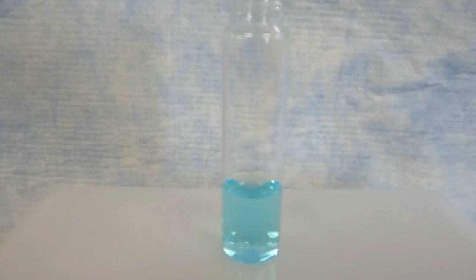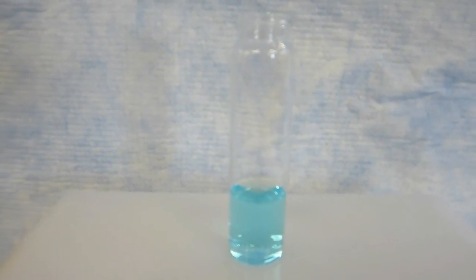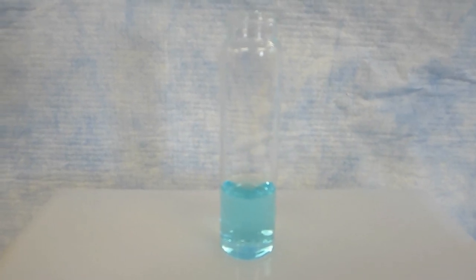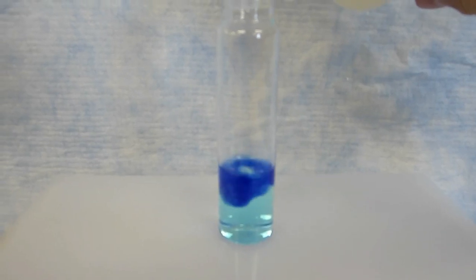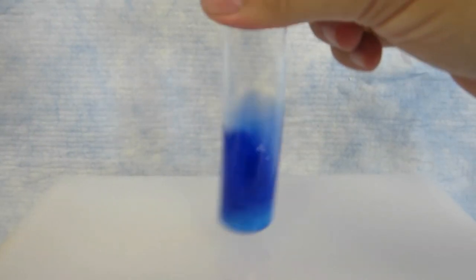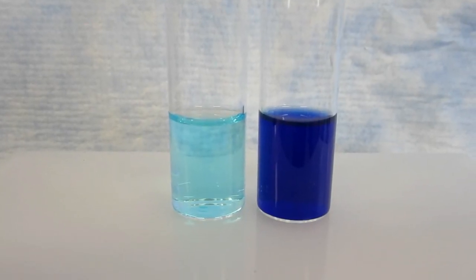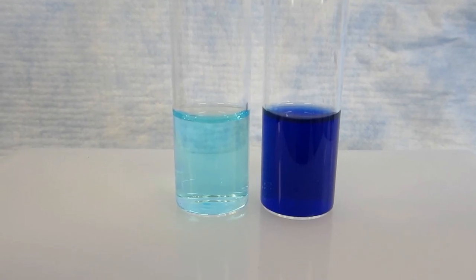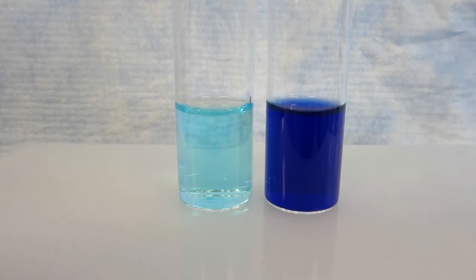The molar absorptivity constant also changes the absorbance. While at the same concentration, the reaction with aqueous ammonia solution creates a much more vivid and dark color, making sure the absorbance has increased. While these two solutions are the same concentration and the same path length, the absorbance is different based on the difference in chemicals.